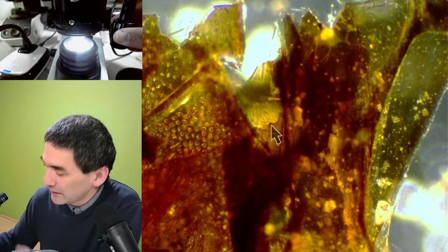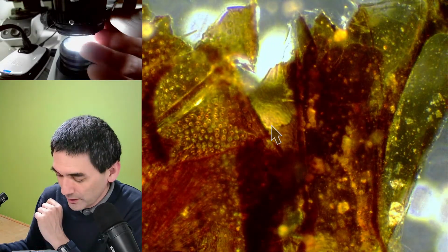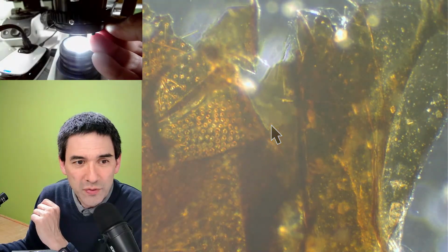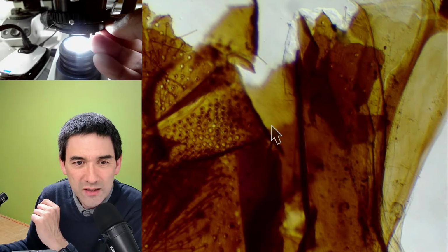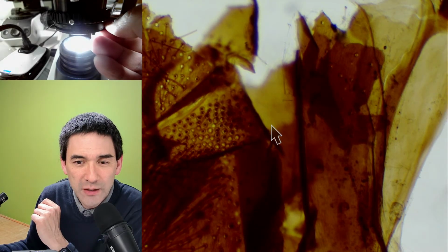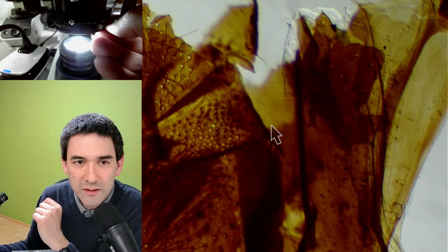So this here, by the way, I've also tried this, is an example where sometimes oblique, because it's so thick, does not quite work as well. Just a little bit, if you just shift it out here, something like this.